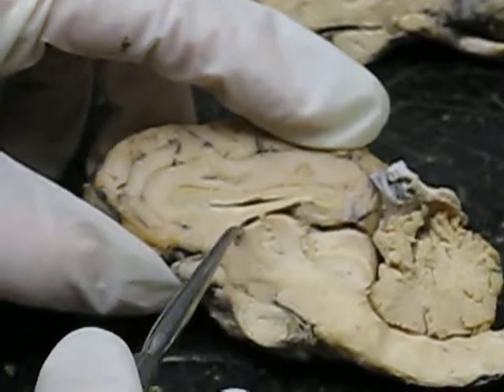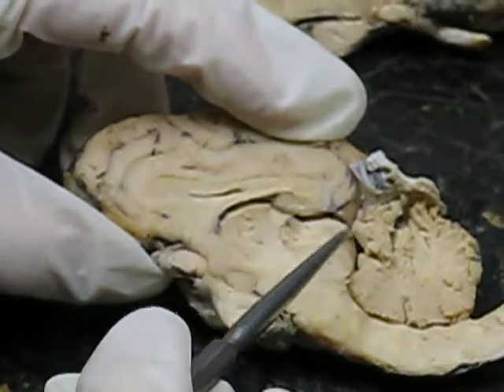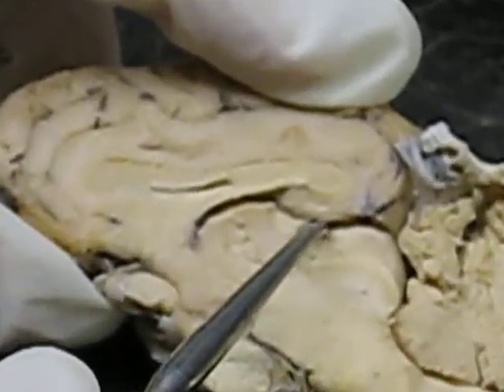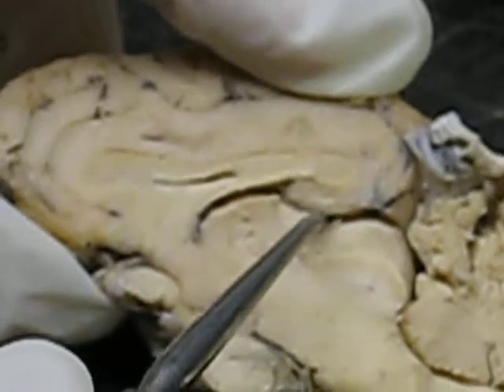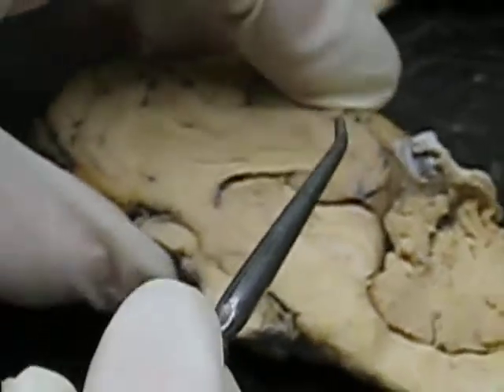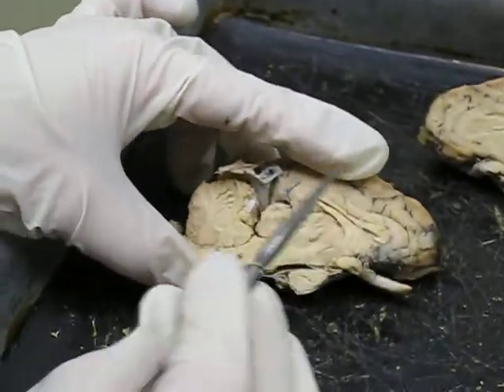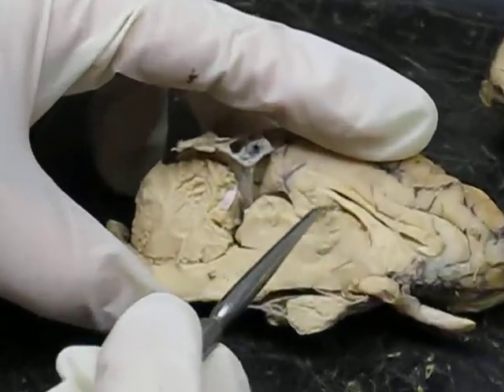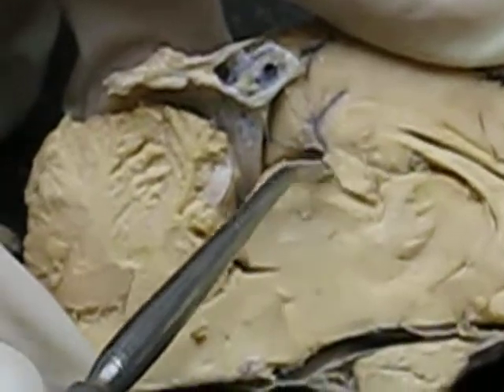The pineal gland, or the pineal body, should be right here in the middle of the number 3 of that ventricle, right on top of the corpora quadrigemini. Corpora quadrigemini are here. Pineal body should be here, but you usually only see it on one half of the cerebral hemisphere, so it shows up better on this half. So right here in the middle of the number 3, you'll find the pineal gland. So that's the pineal gland or pineal body.